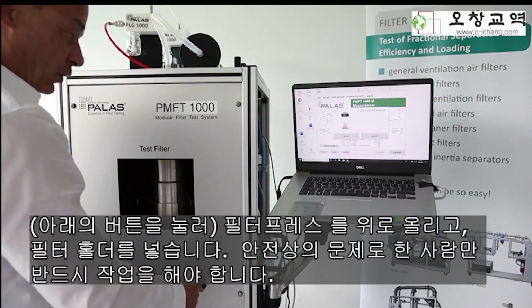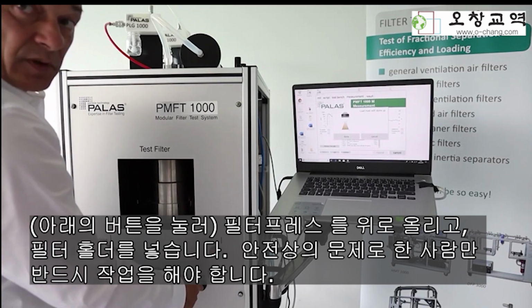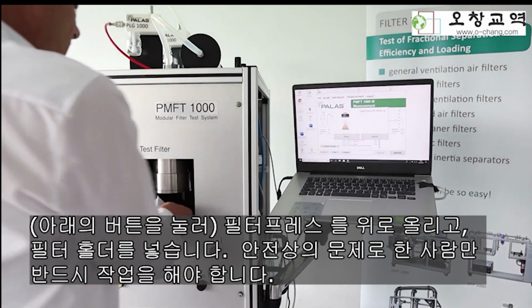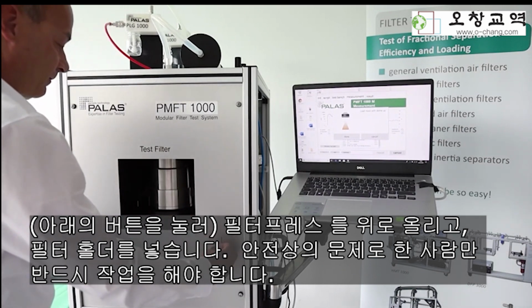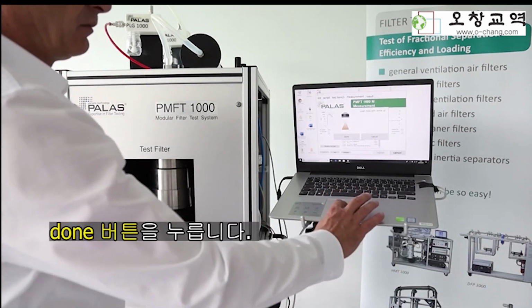Open the filter holder. Please be aware that only one person is allowed to stay close to the filter holder if you open or close the holder. Insert the mask with the holder and close it again. Press the button done.